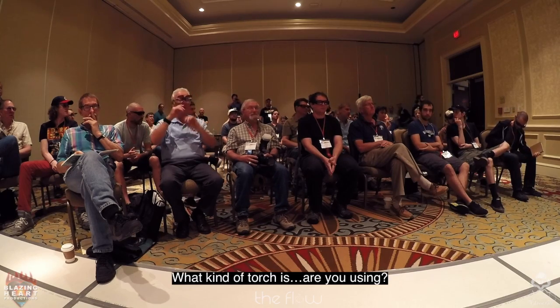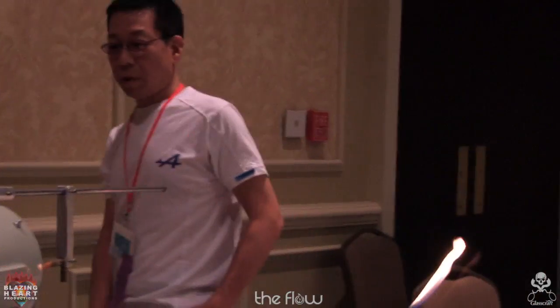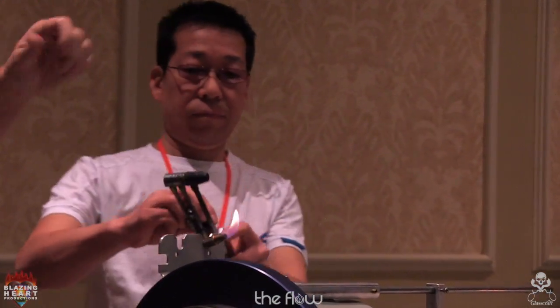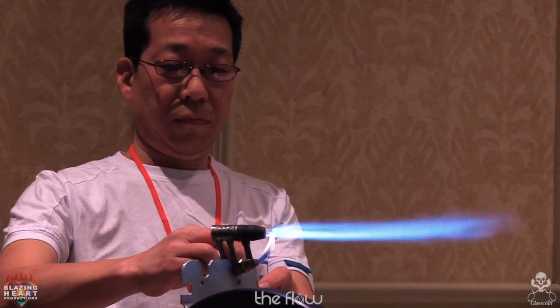What kind of torch is that? Is this Herbert Arnold? Oh, no. Made in Japan. Sorry, can't get one. Got to go there. But it looks kind of like a Herbie hand torch. There were not a lot of hand torches with interchangeable tips like a National. Most of the ones that we saw was a style like this.